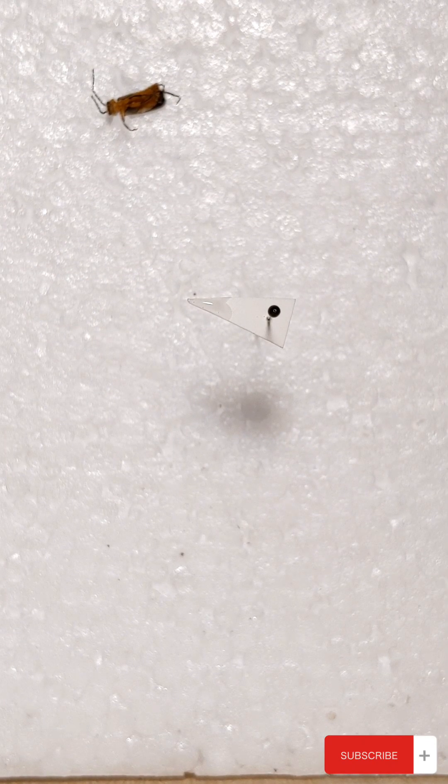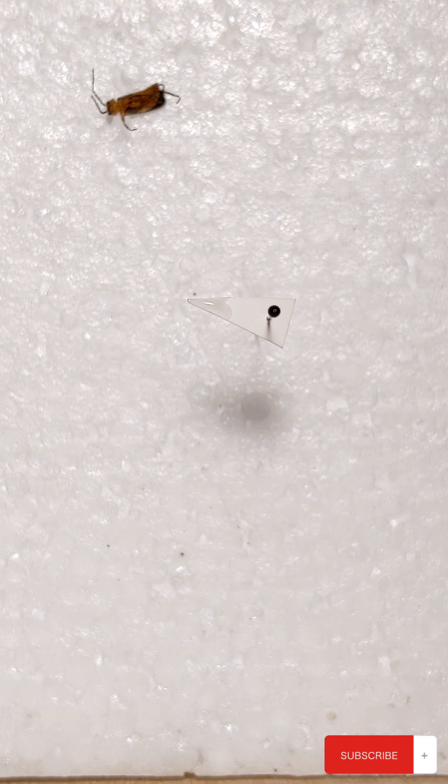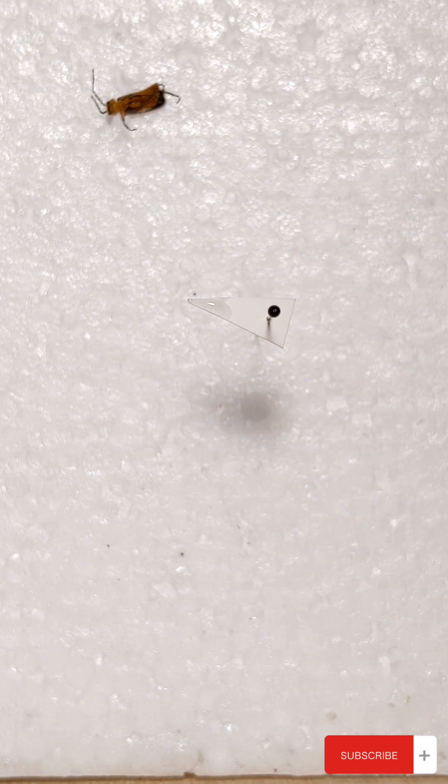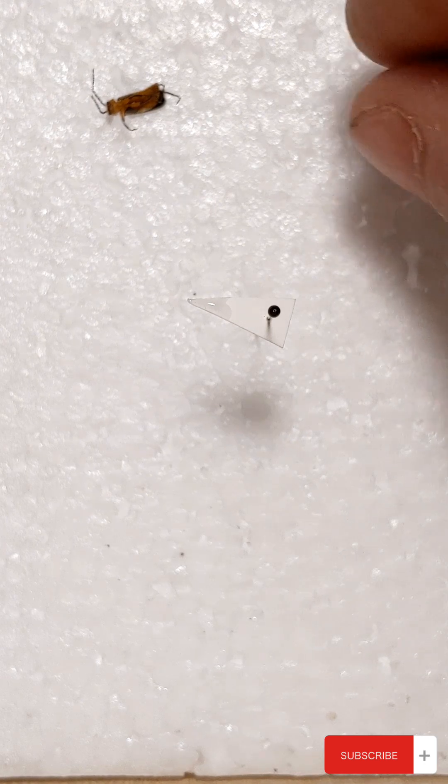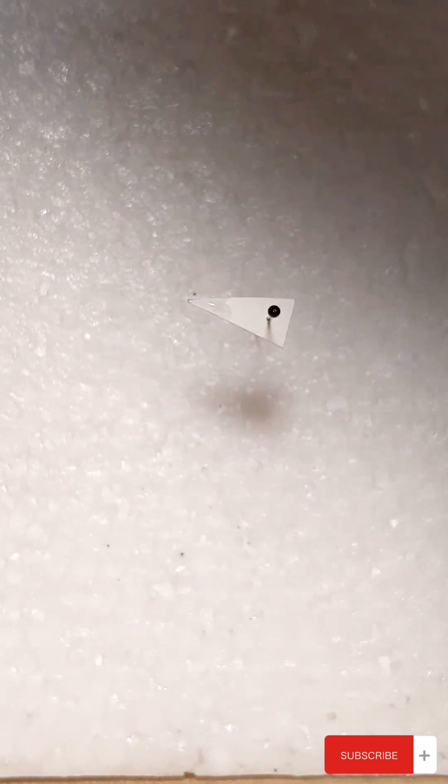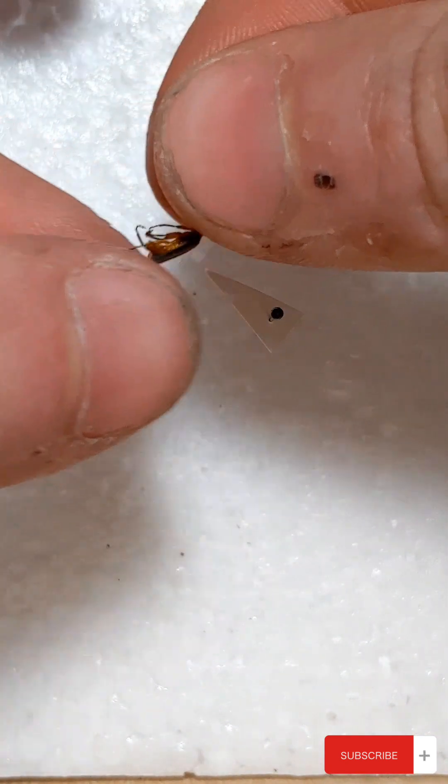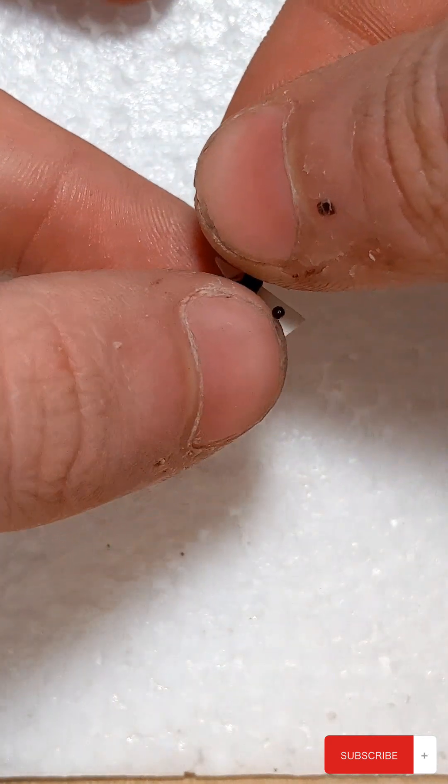And we're going to be putting the insect on just like where you'd put a pin through it. So right through the thorax or that one spot right above the right or left part. Some people use the right or left of the carapace but now we're going to take our beetle specimen here and we're going to put them approximately right over top like so.